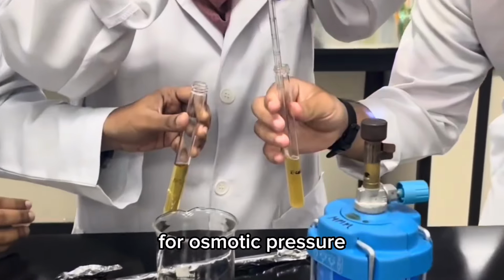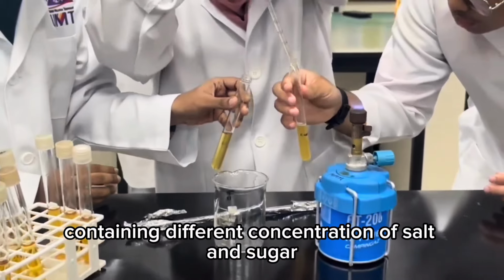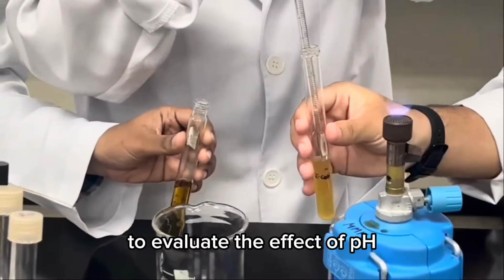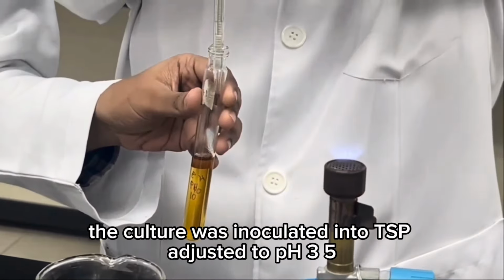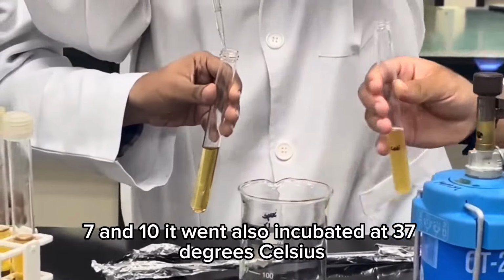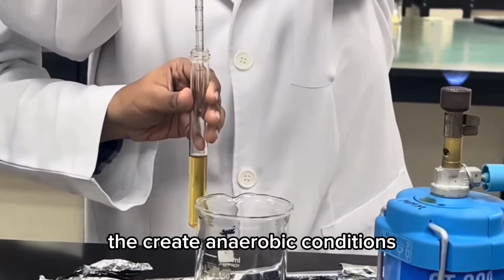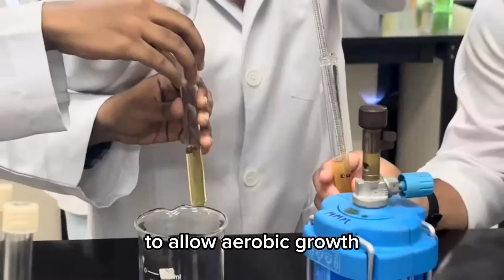For osmotic pressure, the culture was inoculated into TSB containing different concentrations of salt and sugar, and also incubated at 37 degrees Celsius. To evaluate the effect of pH, the culture was inoculated into TSB adjusted to pH 3, 5, 7, and 10, and also incubated at 37 degrees Celsius. For oxygen requirement, one tube was overlaid with paraffin oil to create anaerobic conditions, while the other tube was exposed to oxygen to allow aerobic growth.